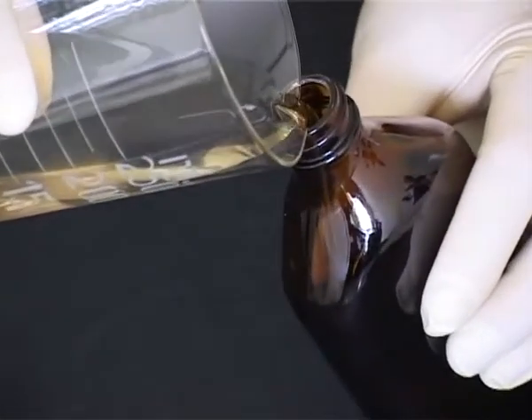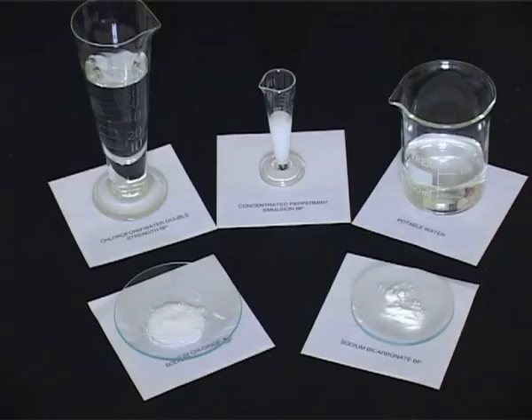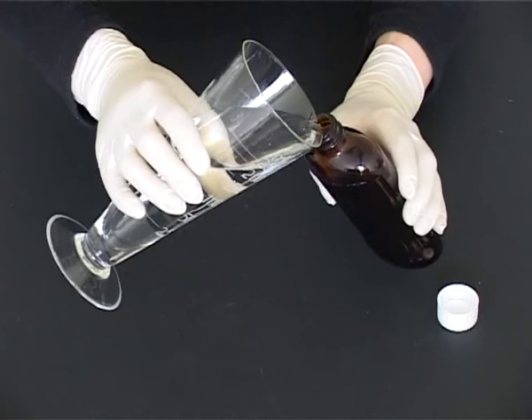Label on the curved side of the bottle and dispense to the patient with a suitable spoon to measure an accurate dose. External solutions are made using the same principles as for internal solutions, although external solutions are packed in ribbed amber medical bottles.